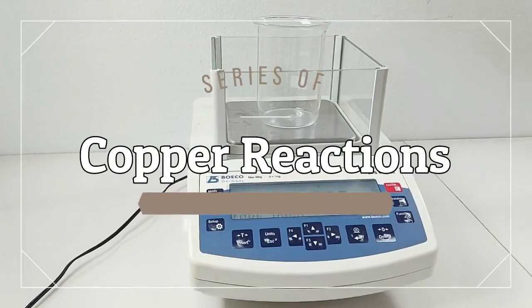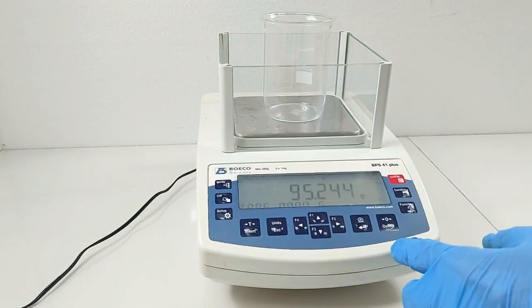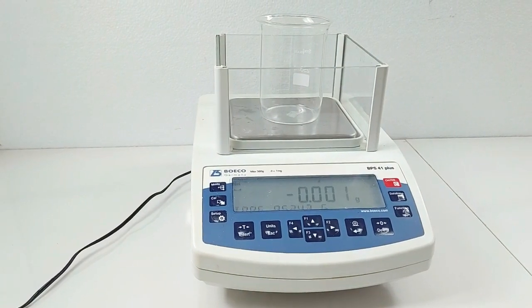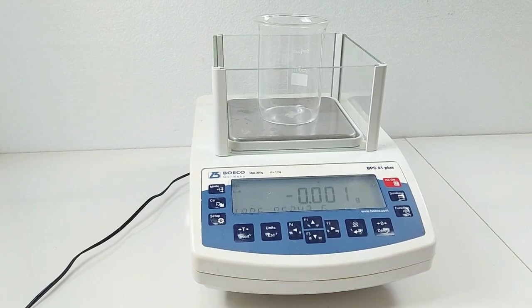Part 2. Series of copper reactions. In this experiment, you will take a copper sample through a series of 5 reactions. The end product will be your original copper sample, making this a cycle of reactions.